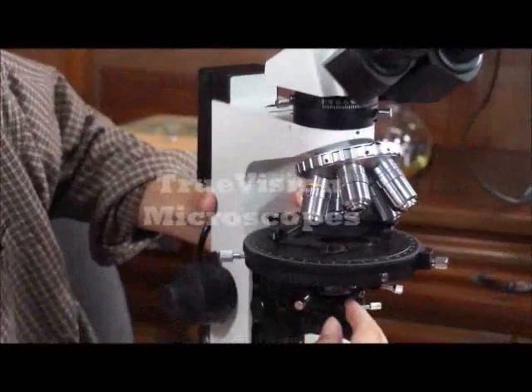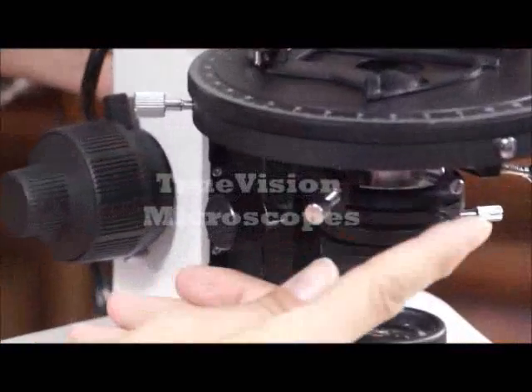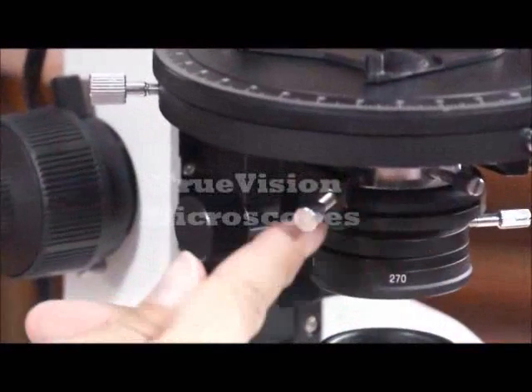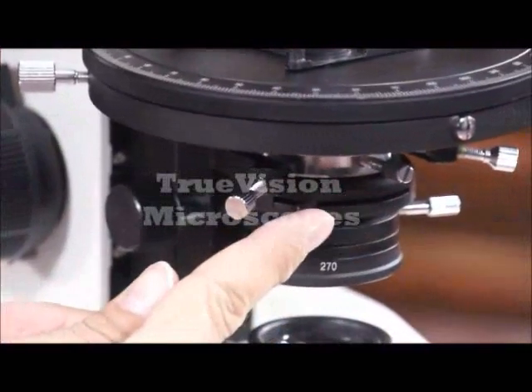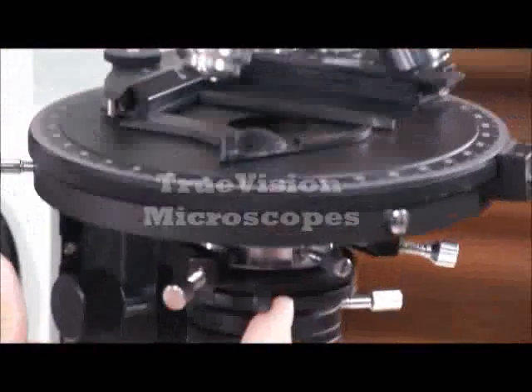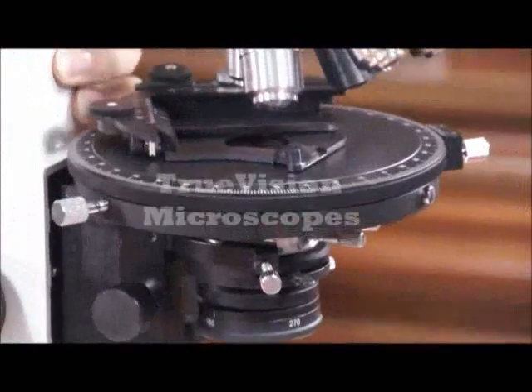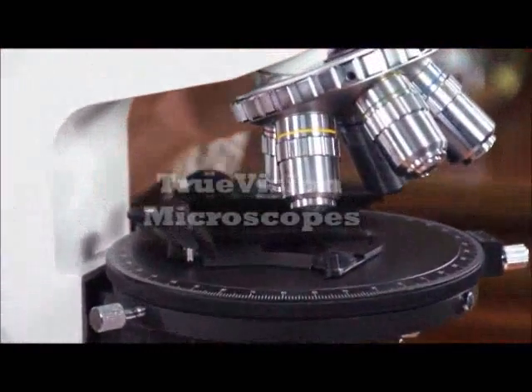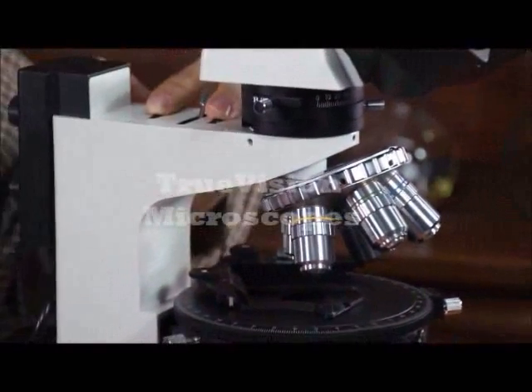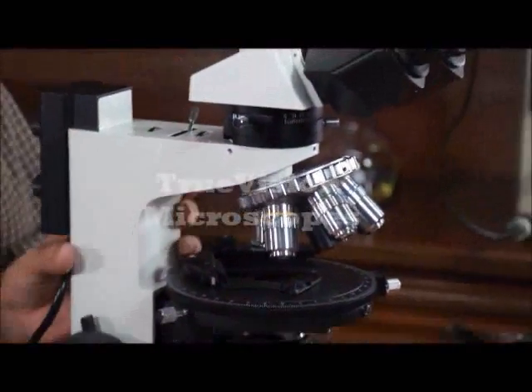You can also adjust the diaphragm — this is an iris diaphragm. You want to close down your iris diaphragm when you're centering. You also have these diaphragms that you can turn down when you're centering for the reflected illumination.